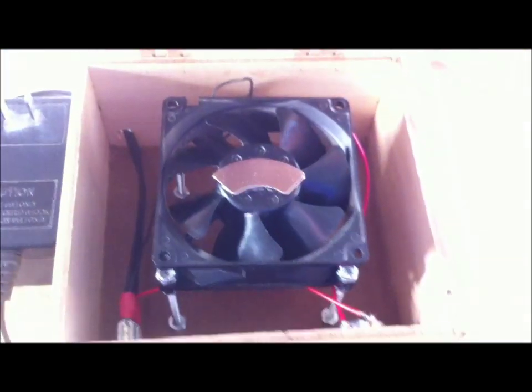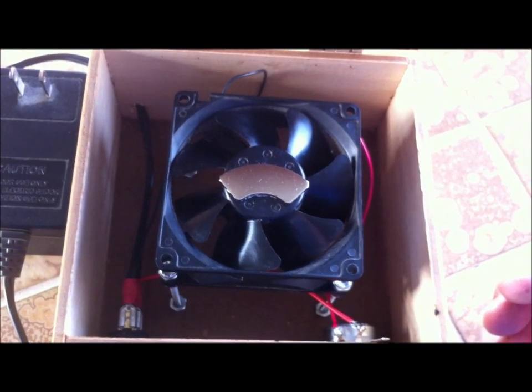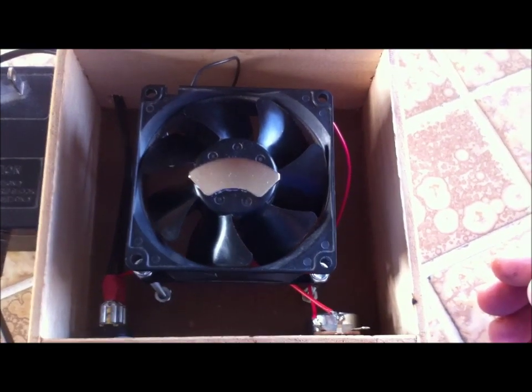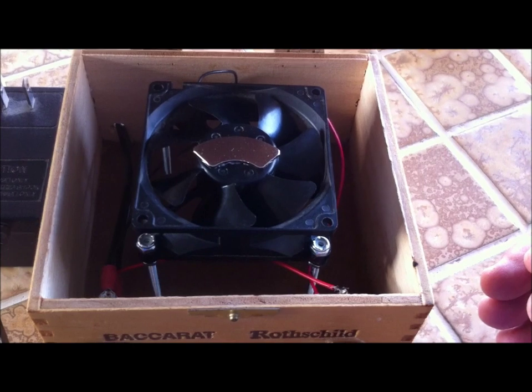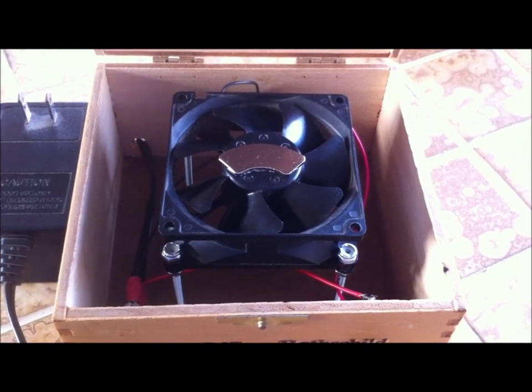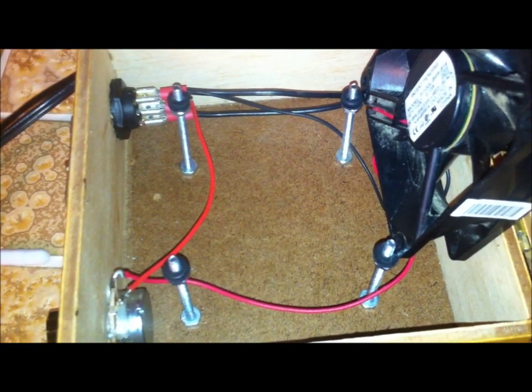Take a look at the inside — this is basically what it looks like. I did bolt everything to the bottom; I just didn't want bolts on top, though you can mount it on top just as easily. You can see the wiring on the left-hand side going to the rheostat, and on the right side the toggle switch. The second part of this video is basically to show you the wiring — that was the one thing I did not find on YouTube, really how to set one of these things up. I'm not an electrician, so follow along and I'll be taking the fan off and showing you in detail where to wire everything.